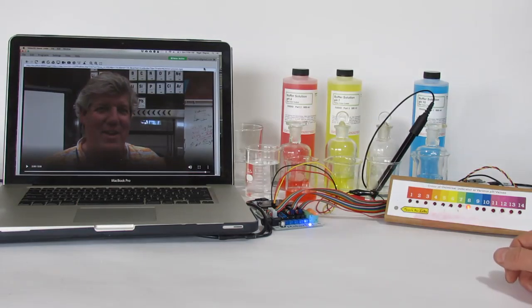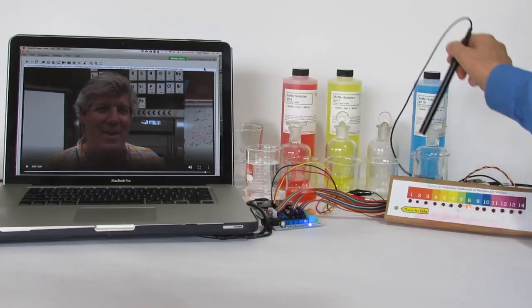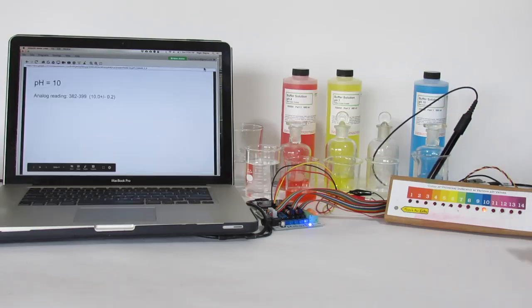Well that shows the idea. Our last sample is pH 10 and we'll just see what happens there. Currently it shows 8. We'll move it here and the slides change for that. And so there you have it.